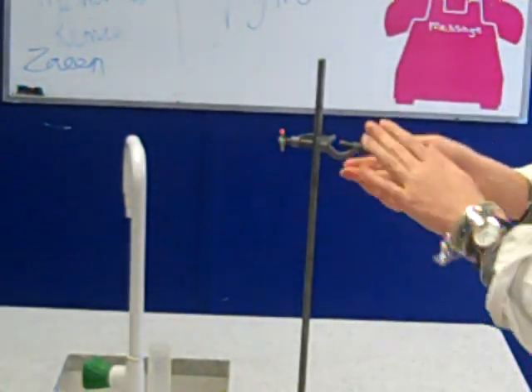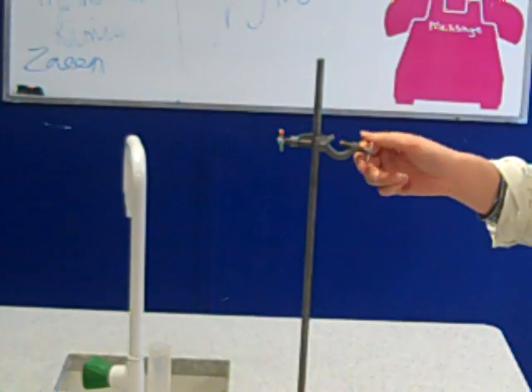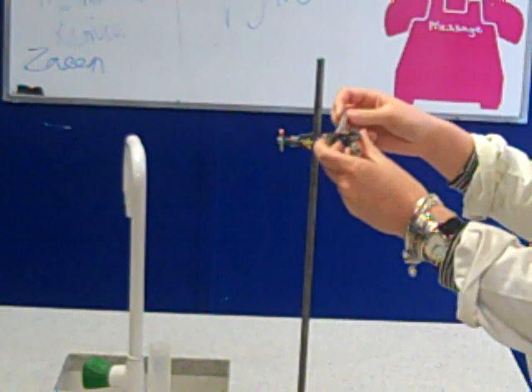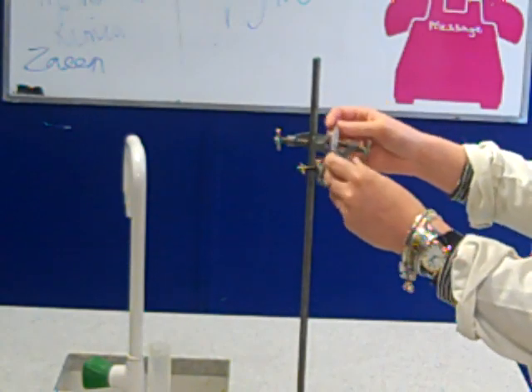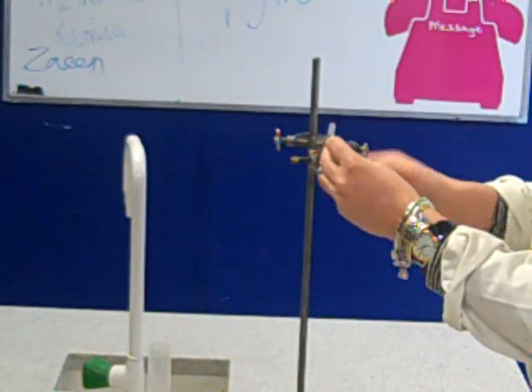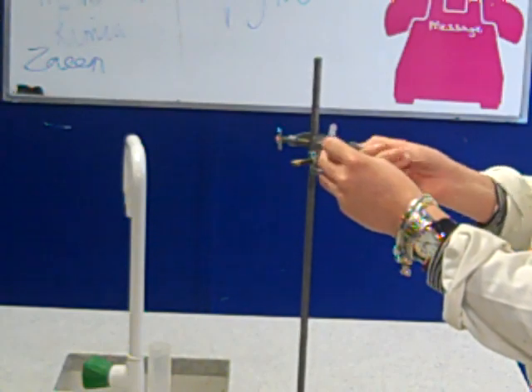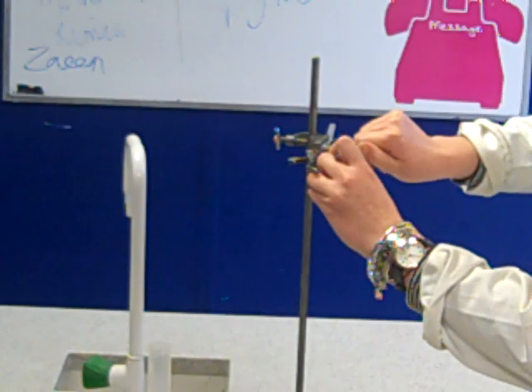Next part, we need to put our clamp on. So again, we need to make sure we unscrew the screw enough to fit our clamp in. So again, pop the clamp in the boss and again, tighten it so it's nice and tight so our boiling tube isn't going to go anywhere. It's going to stay in there.